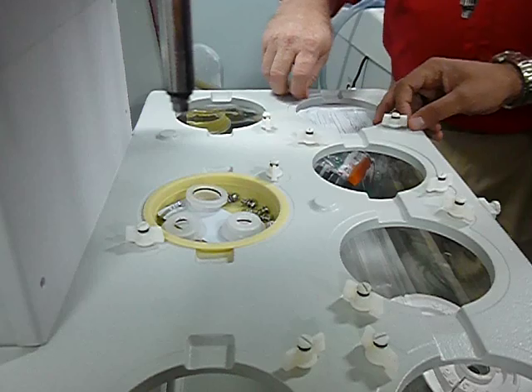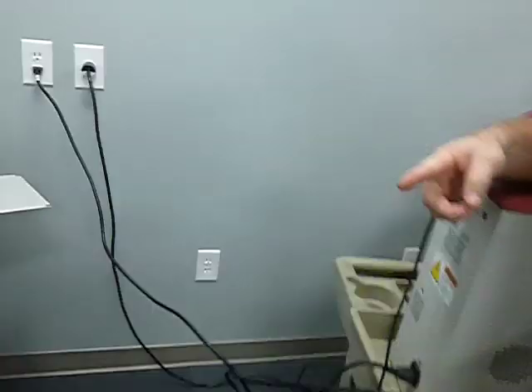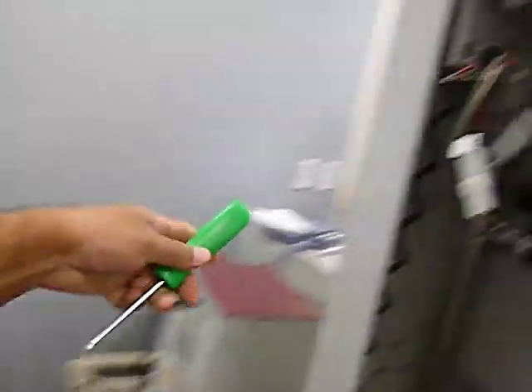Watch. Hand me the green screwdriver behind you. Green right there. Oh, on the side? Other side. Other side. Okay.